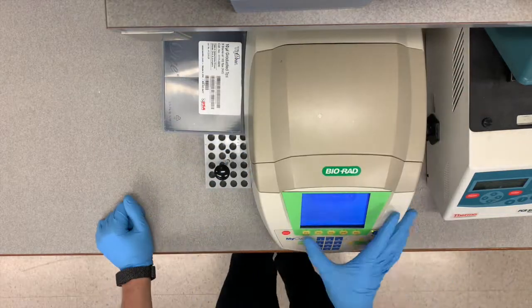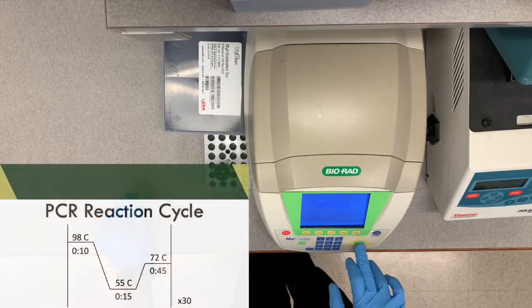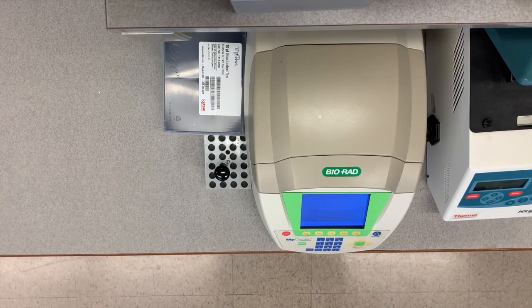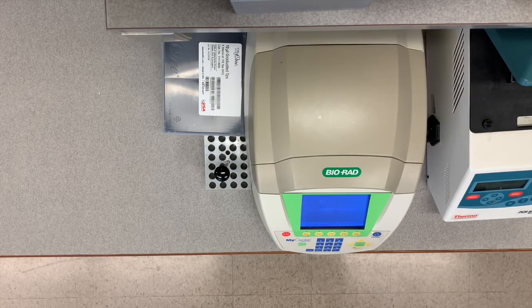Those get loaded into the thermocycler, and then they're going to run in a normal PCR reaction, with the only difference being the 72C step, which we're going to increase to 45 seconds. A general rule of thumb is that you do about 5 seconds per 1,000 base pairs, and my plasmid is about 9,000 base pairs.